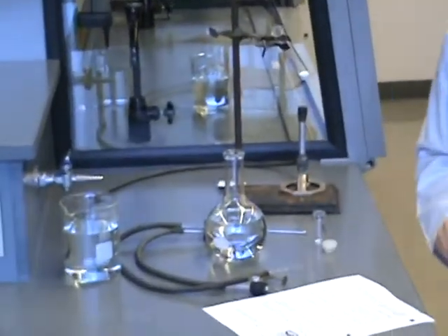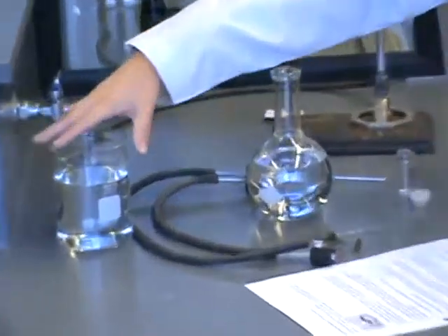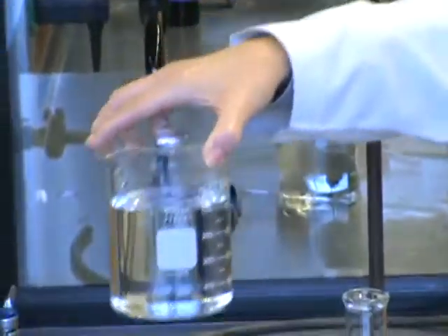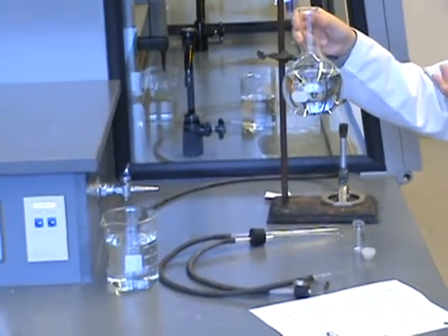First step, it says fill the flask in the beaker about two-thirds full of tap water. Get a large beaker, put some tap water in that. Here's the flask. I put some tap water in that.